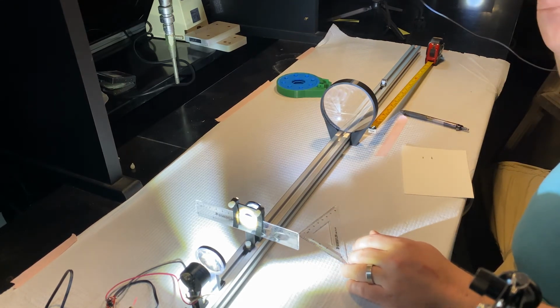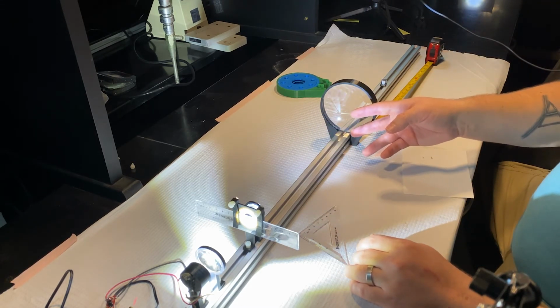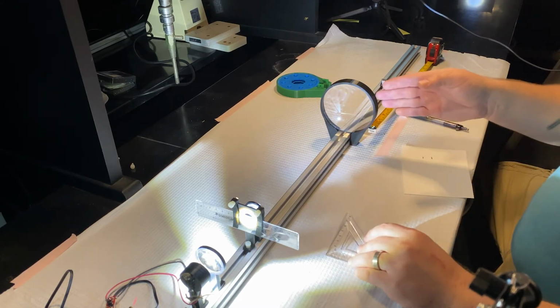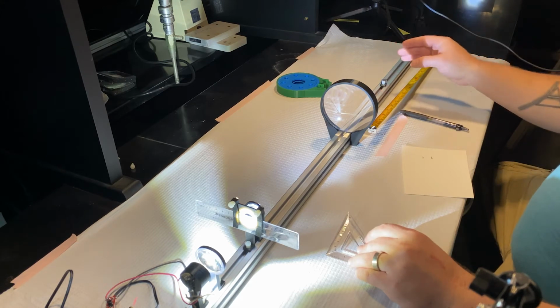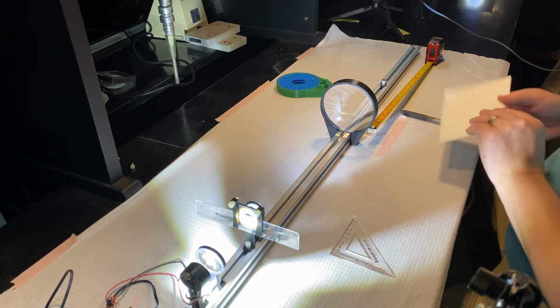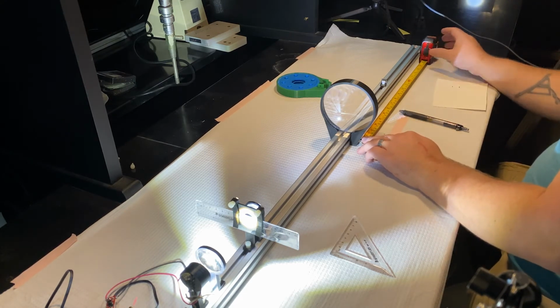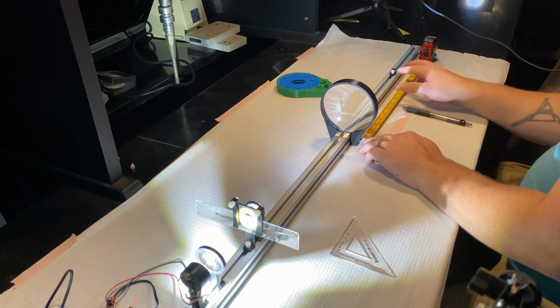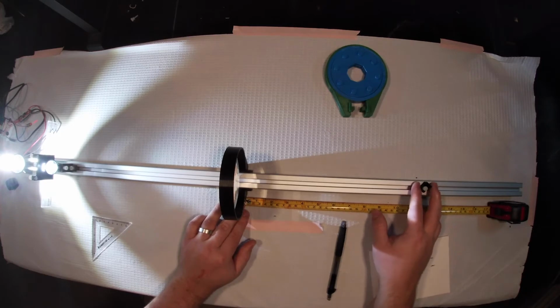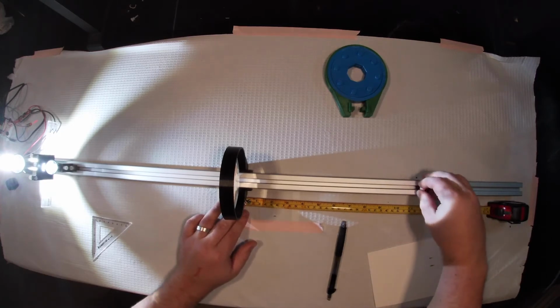And our tube lens takes that collimated light, basically something that is an infinite distance away from this, and refocuses it back down to an image at one focal length away. So, to quickly measure this, we're going to need to put our focal plane right about there. Looks good to me. Tighten that down.